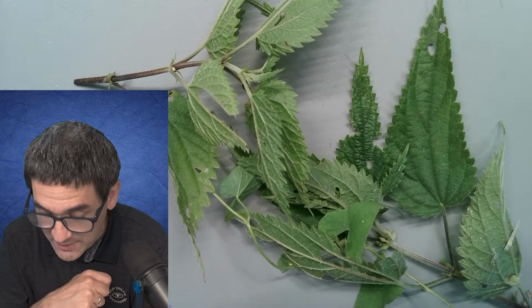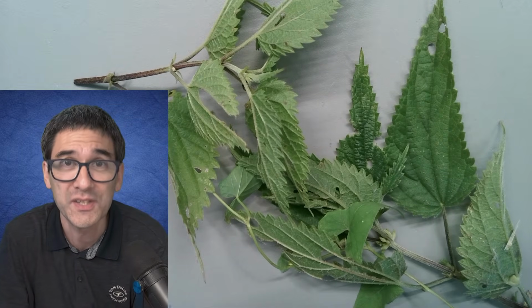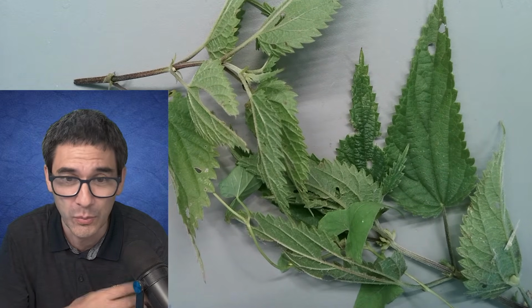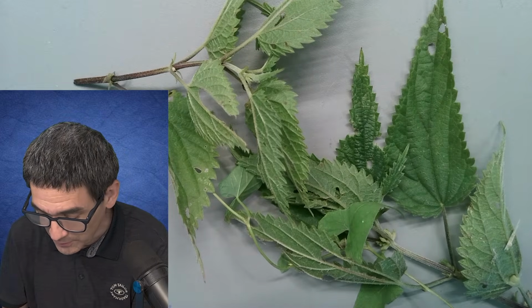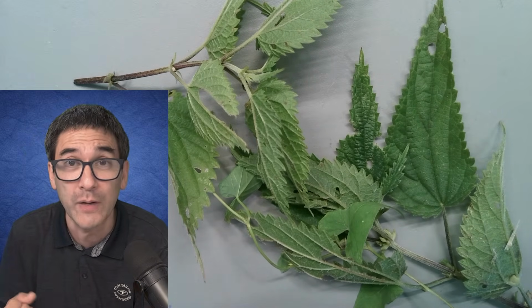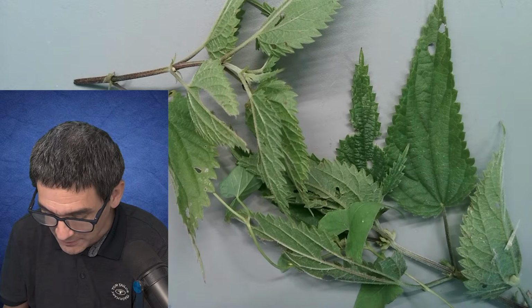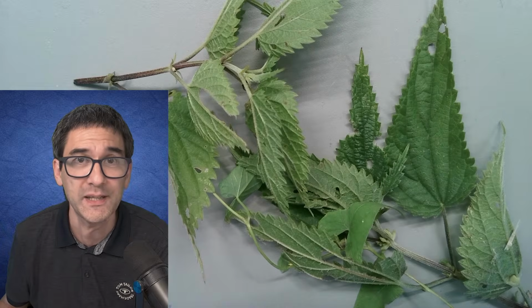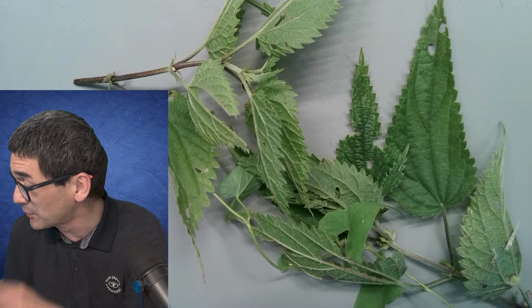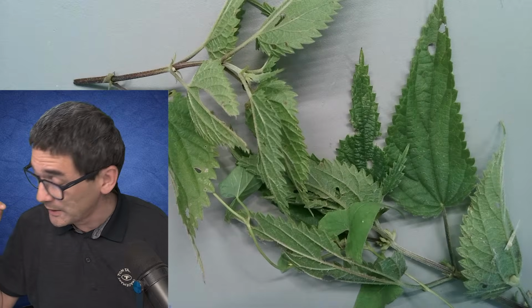One of the things that I would like to show you, I'd like to put this under the stereo microscope. There's been a request a couple of weeks ago that I do a little bit more stereo microscopy again, so why not do that? This one I collected just a few hours ago, but you can see it's a little bit dried up already. I found a couple of spiders on this plant sample, 2 spiders. I'm also going to look at this. And then, of course, also a little bit of a recap from last week.